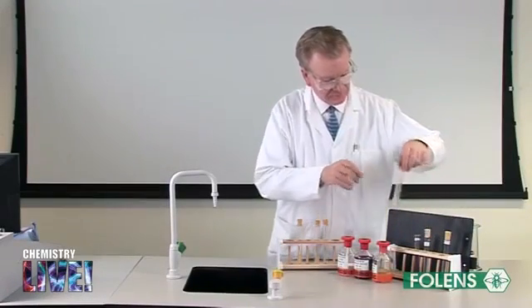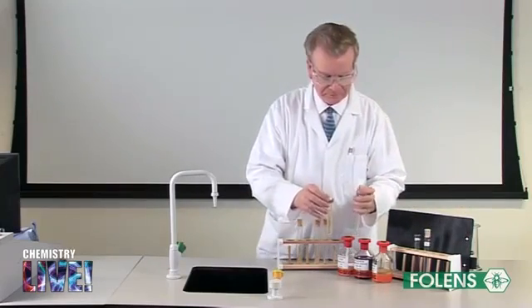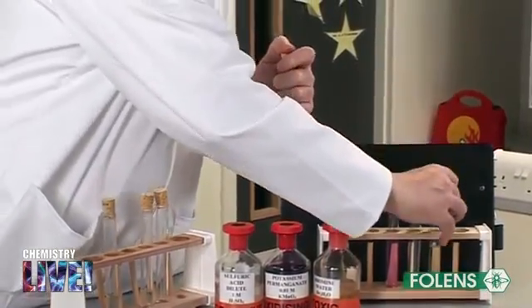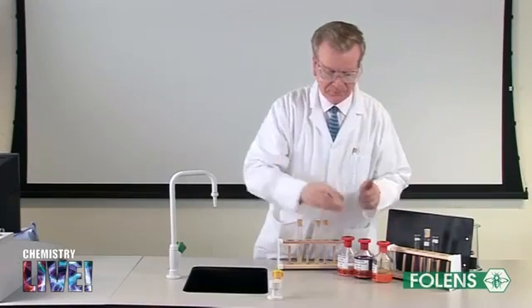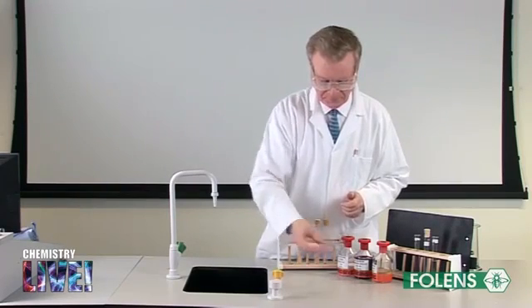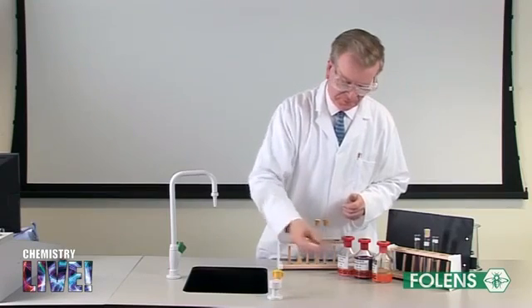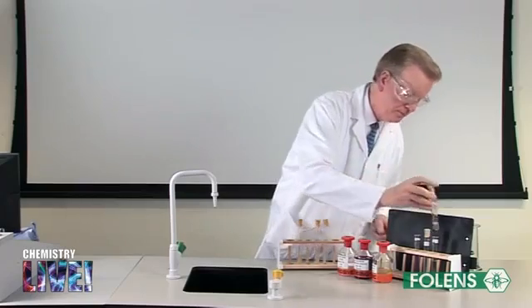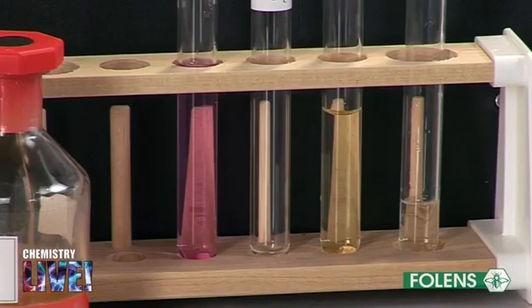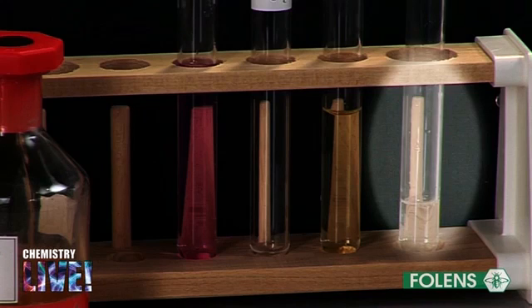Addition of bromine. Bromine can be used to test for unsaturation. Add about one-tenth of a test tube of bromine water to a test tube of ethyne. Replace the stopper and shake the test tube a few times. Note that the yellow colour disappears. The very reactive carbon-carbon triple bond reacts readily with the bromine. You are not required to know the equation of the reaction or the names of the products for this course.